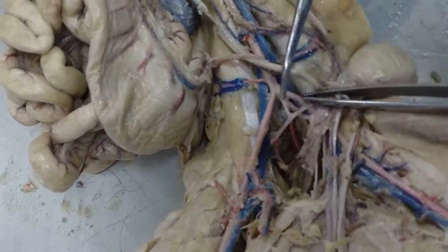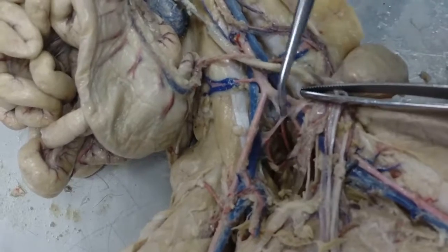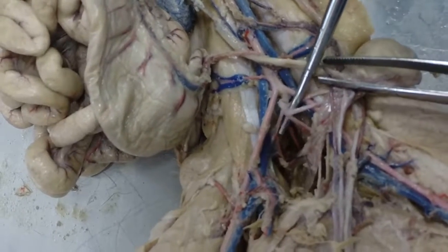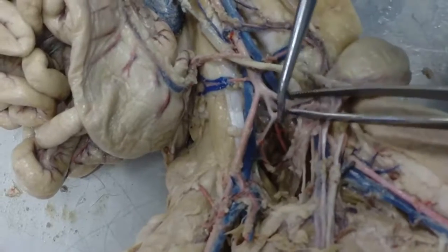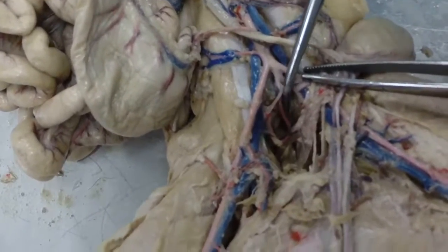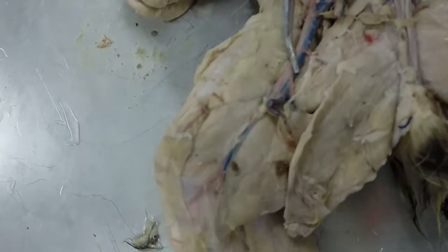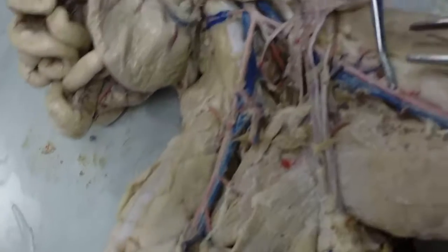And then if you look really closely in here, you can see a second set of branches. So this one right here would be the internal iliac artery right there, and that would be a left. And then you have this little artery that goes straight down, and that's the caudal artery right in there. Okay, the external iliac artery is going to continue out across the leg, at which point we call it the left femoral artery, or this would be a right femoral artery. This would be a left femoral artery.